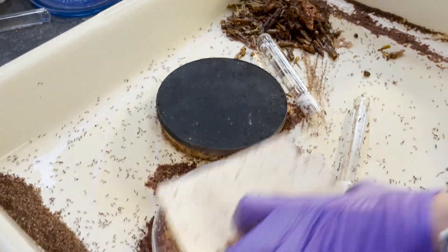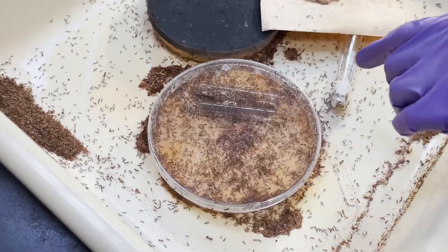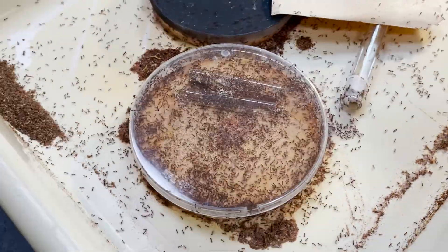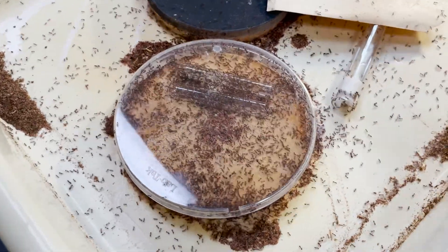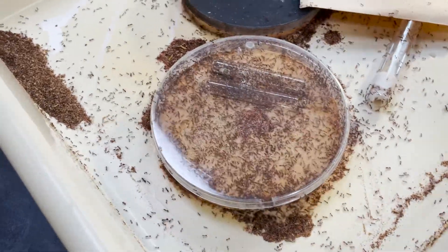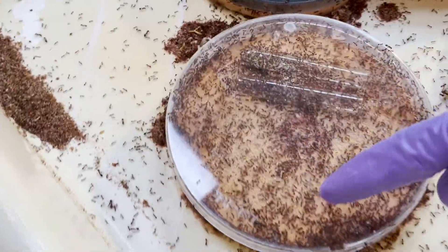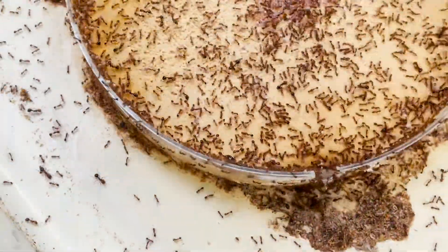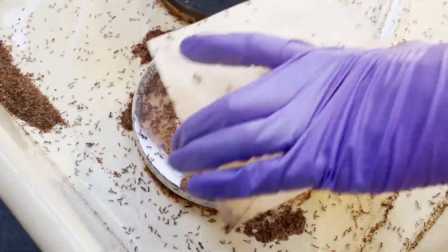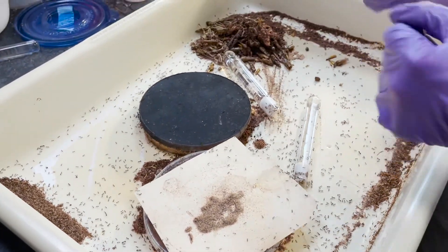This is a weaker colony. The colony is getting smaller, so I gave them two small nest structures for them to live inside. Imagine if you are a small family — you don't want to live in a vast open space like a big nest. They will feel more secure if they have more structure inside the nest. The queen is running around right there. Just put some water on it, put it back, and close it back up. Do that twice a week and that will keep the nest moist and the ants happy.